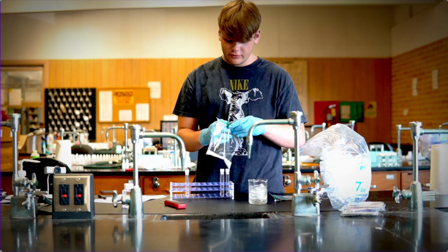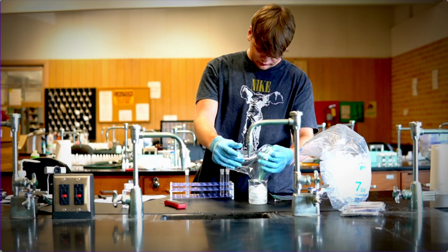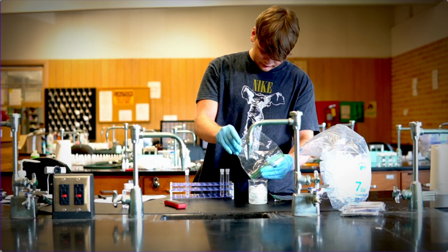Oh, before you do that, very important, remember to write down the temperature of the ice after, right? So we wrote the temperature of the ice before, write down the temperature of the ice after, and then after that you go to the next part, where you not only use ice but we add salt into the ice. And if you remember correctly from our experiment, this should affect the freezing point, right?